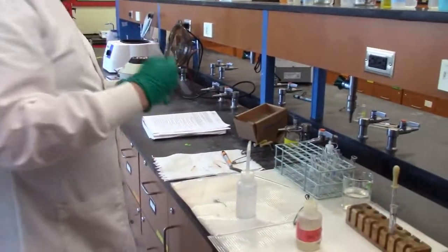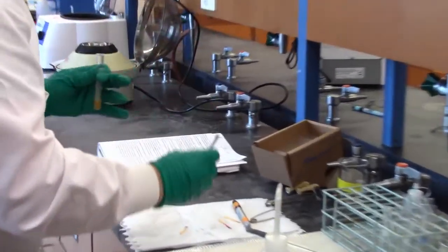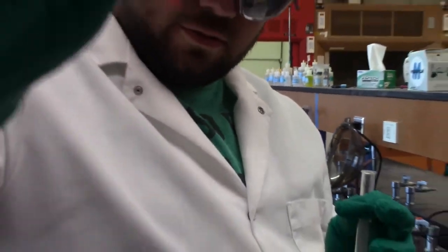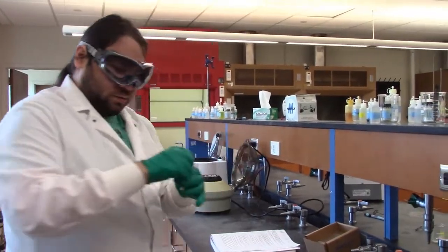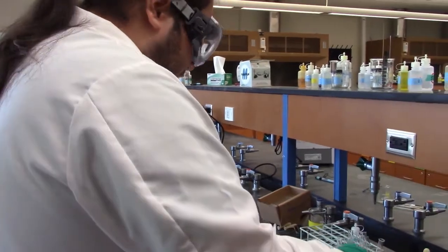Just to double check, let's take a quick pH reading. I'm trying to get down to the paper. Poorly, but I'm trying. And it did come off as red. Hang on, I've got to back it up. It did come off as red, so we have our acidic solution now. The cloudiness pretty much means it's in there, but let's keep going with this anyway.